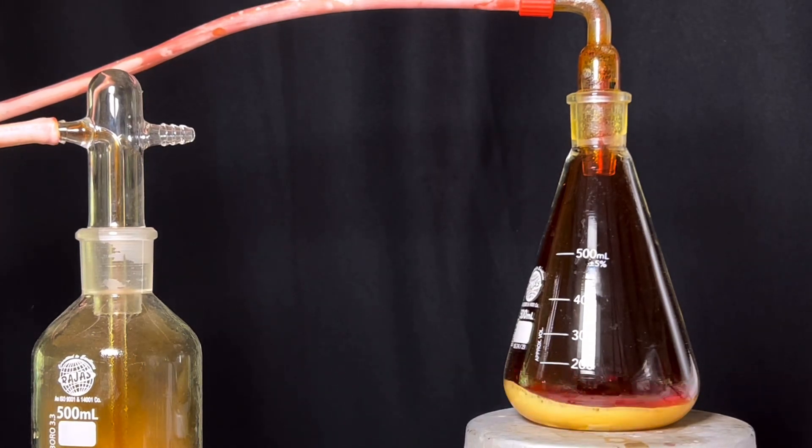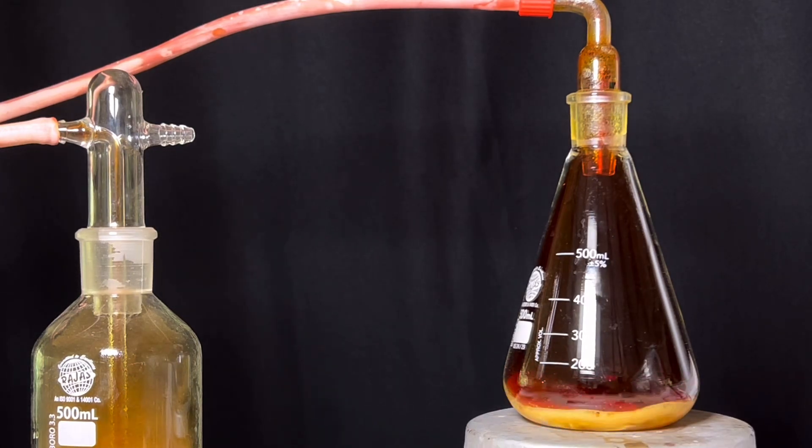Nitrogen dioxide is toxic. So make sure you do this experiment in a fume hood or in a well-ventilated area.